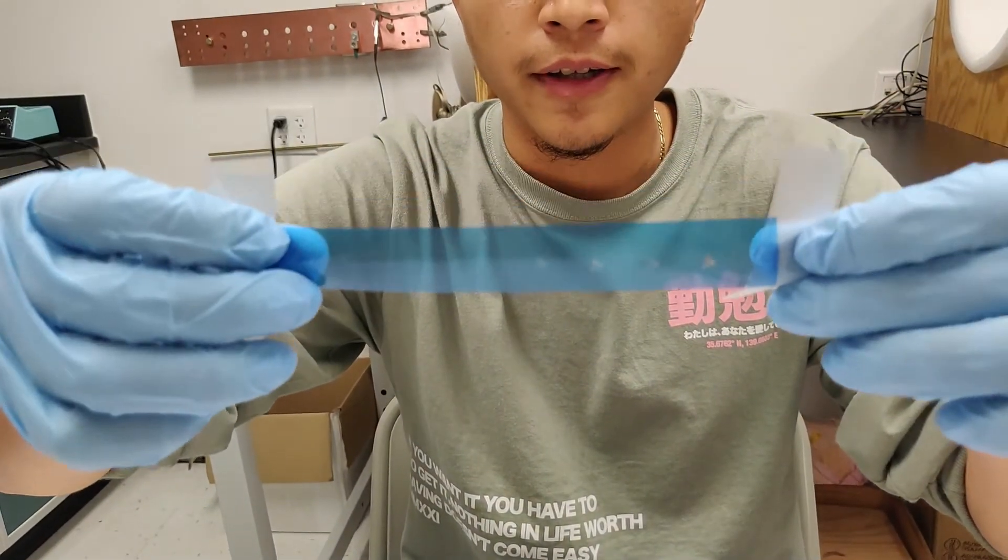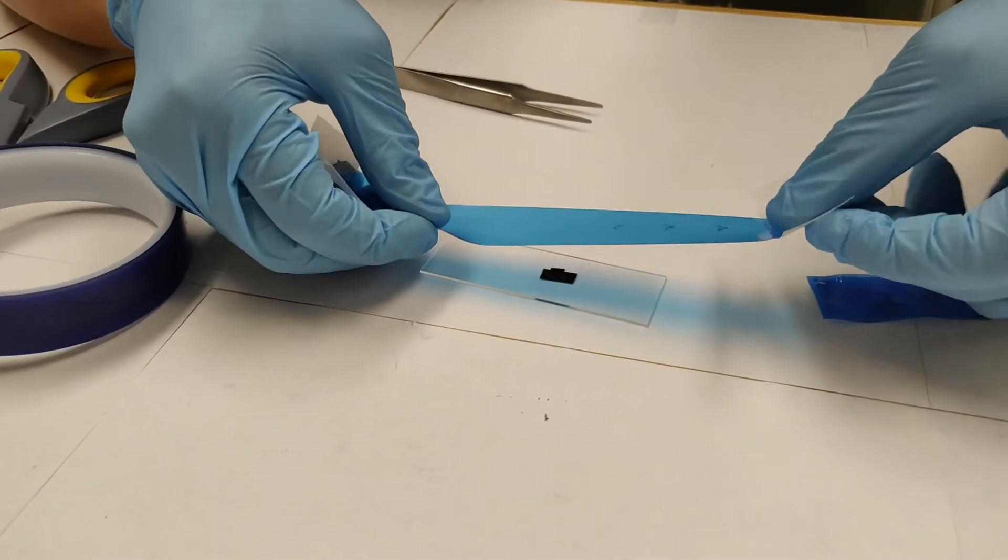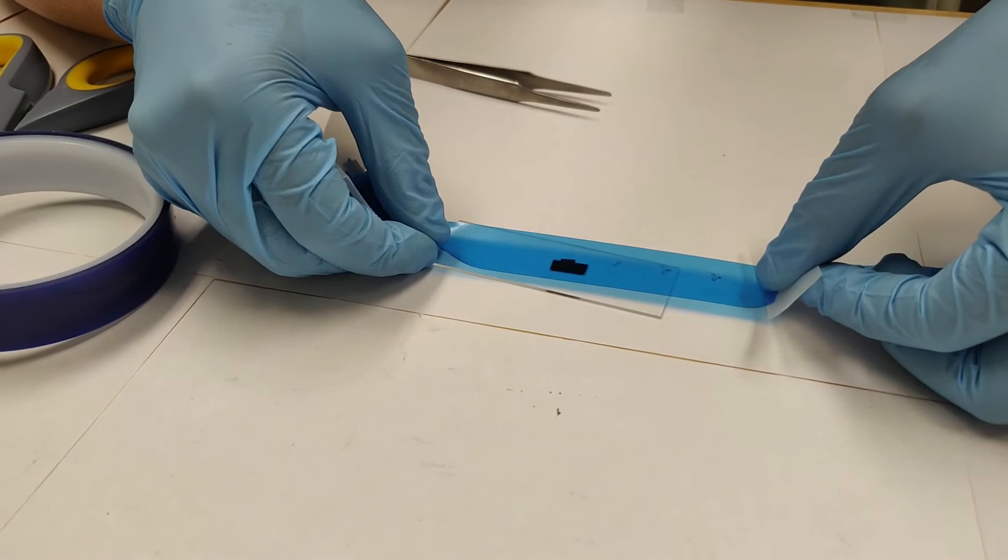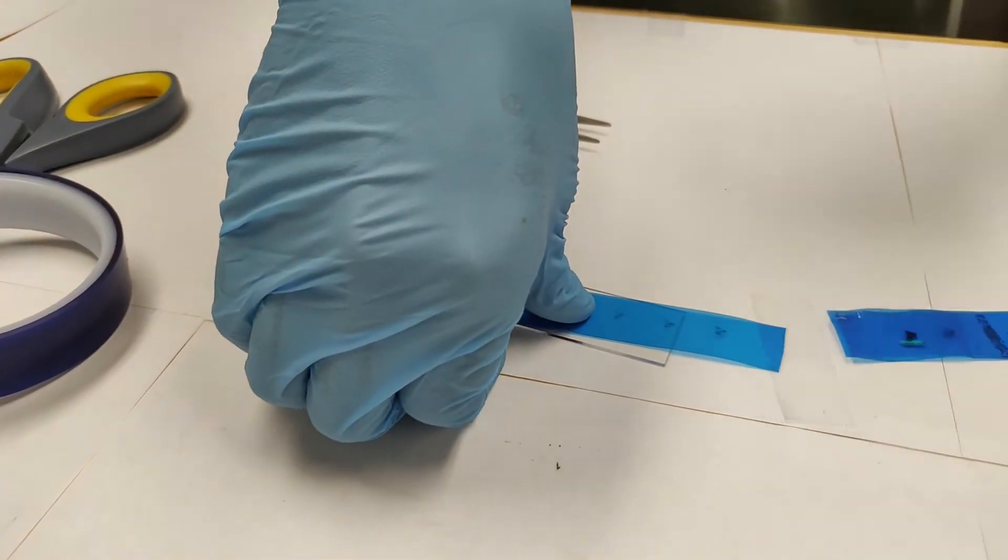So here I'll be using the thinnest layer to exfoliate onto the chip. And then you press it over the chip and hold it down for about 30 seconds.